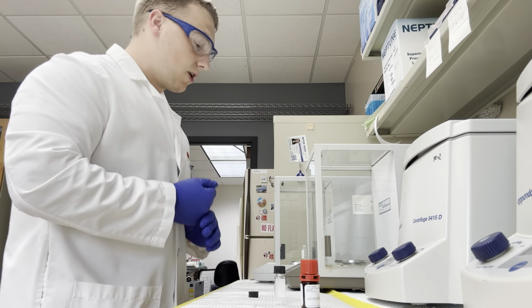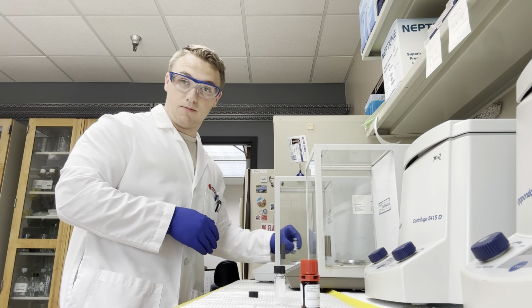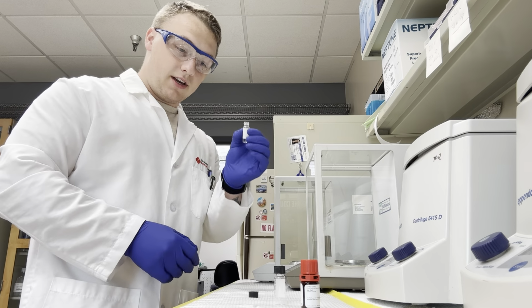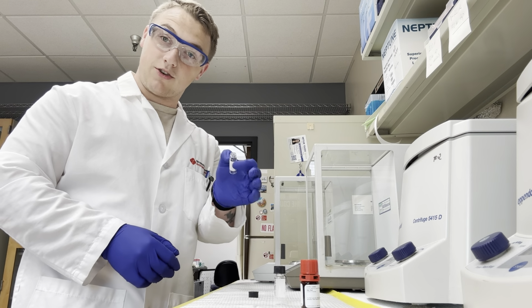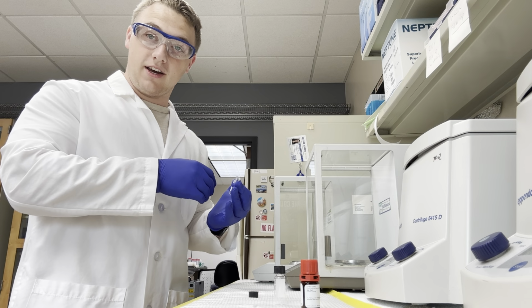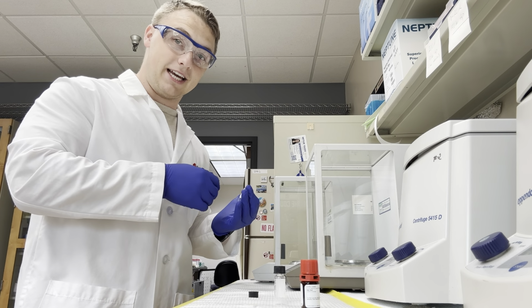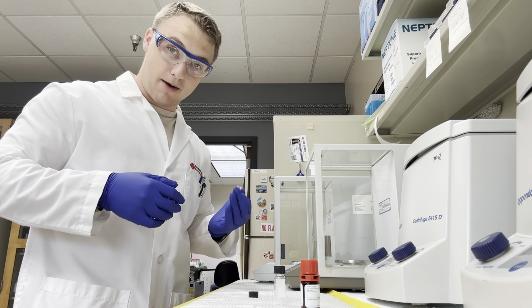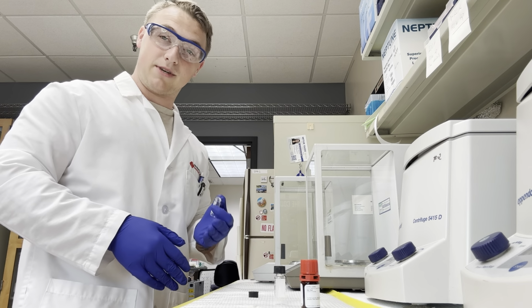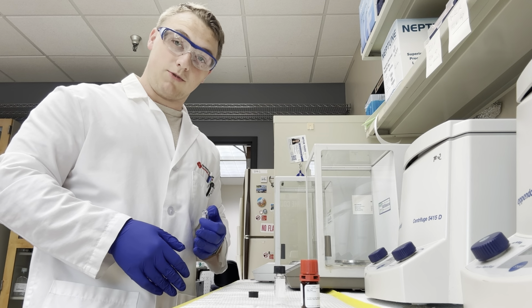Okay, so when we're zeroing with these vials, and with any vial in particular, you want to be consistent with your measurements. If you zero it with the cap on, make sure the cap is on once you have your sample in the container. If you don't do it with the cap on, make sure when you have your sample in the container, you weigh it without the cap on, if that makes sense. Just be consistent with your measurements. These little caps have weight, and they will alter your measurements significantly, so make sure to keep track of that.